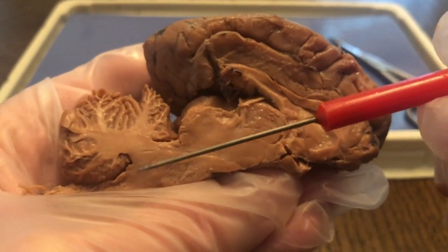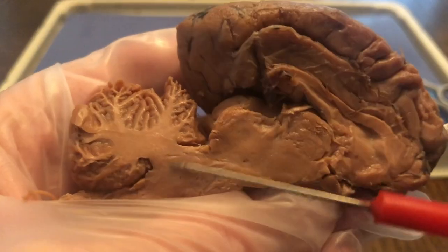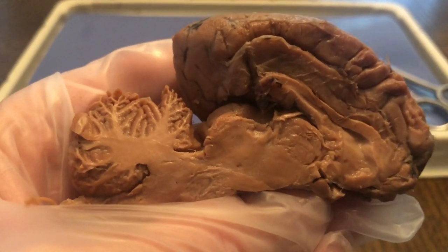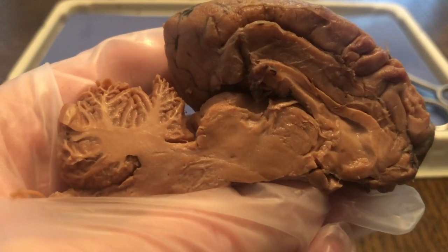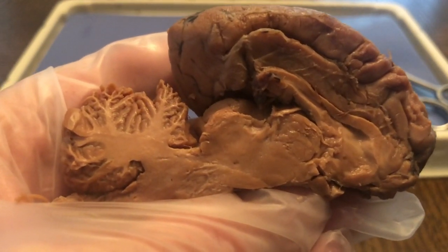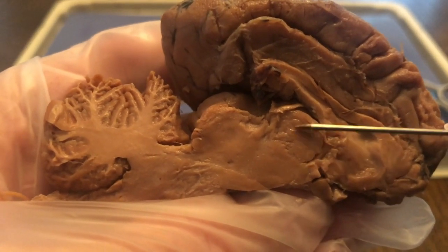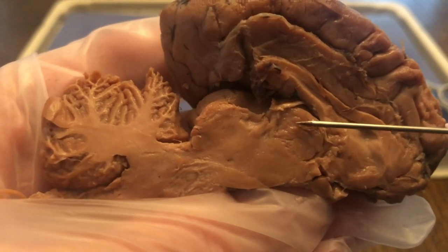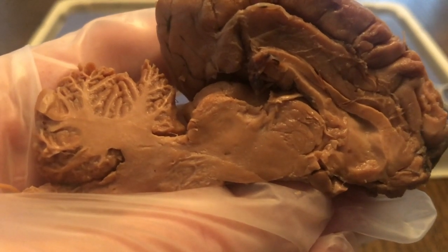Now down here, in this region, we will have the medulla oblongata. And the medulla oblongata, this region here, controls respiration, which is breathing, circulatory system, heart function, digestion. It controls sneezing and swallowing. And if we come right here, you can actually see this region here would be the thalamus, and this actually controls pain, pain perception. And below that, we actually have the hypothalamus.